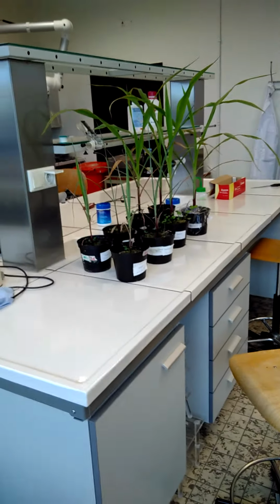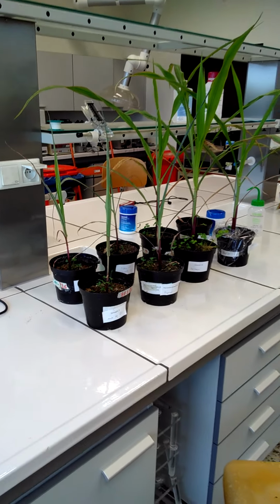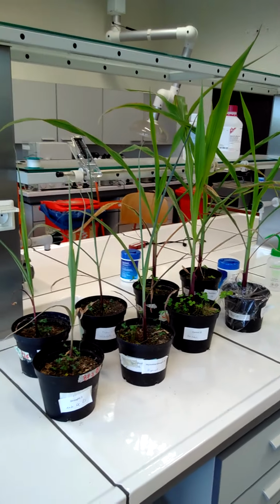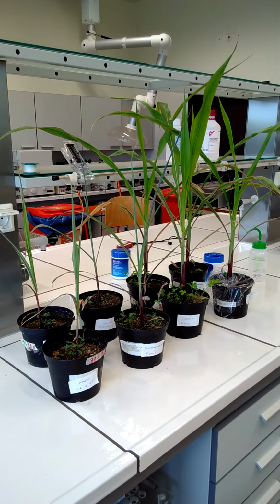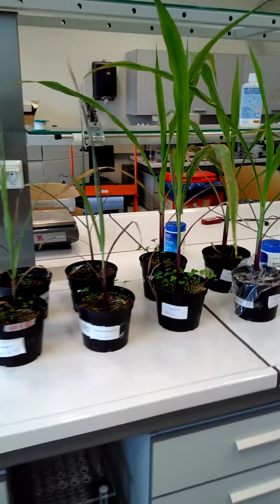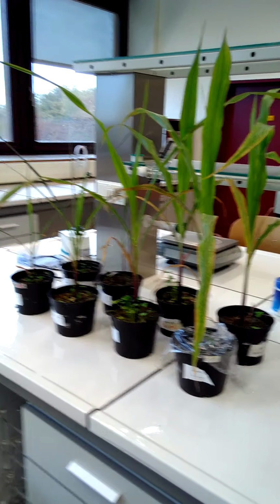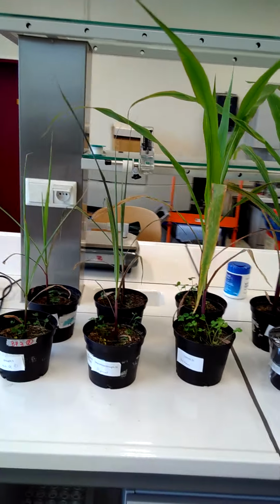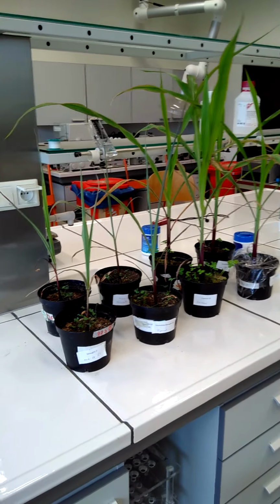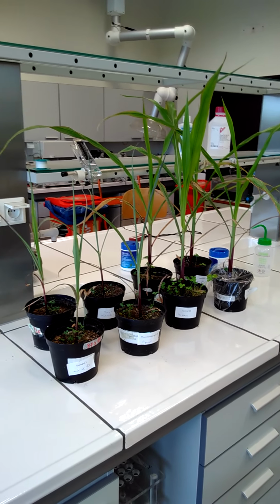Today we will work with these plants over here, these maize or corn plants. I think you all know the principle that there are 4 different treatments, so combinations of drought and mycorrhiza treatments. I think by now, after a couple of weeks of growth, the difference is very clear. What we will do today is compare transpiration, so the loss of water, among these 4 treatments.